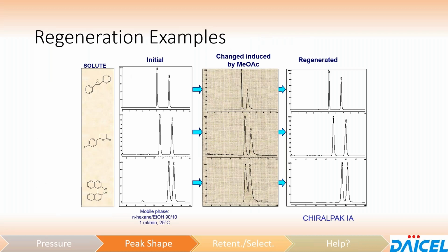So this is an example of an IA column running a hexane, ethanol, normal phase mobile phase, and 3 sample analytes over here. The sample solvent itself actually contained methyl acetate as an injection solvent, and so over time you actually see a degradation in the chromatography induced simply by the sample solvent. But if you take the column and regenerate it through a regeneration process that we have, you can actually restore the chromatography. So sometimes all is not lost. If you do see changes in your peak shape, there's a chance that you might be able to save it, and that's something that we can definitely help walk you through.